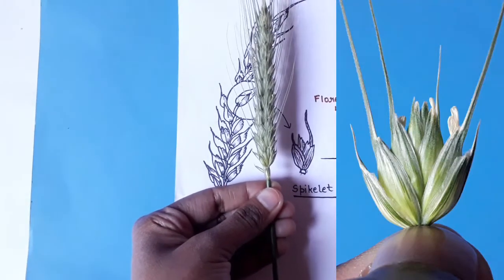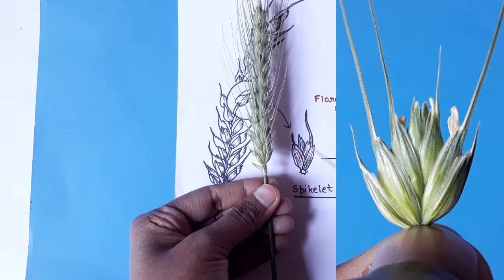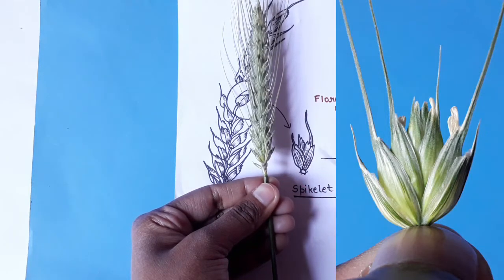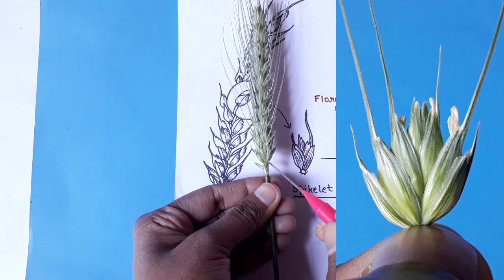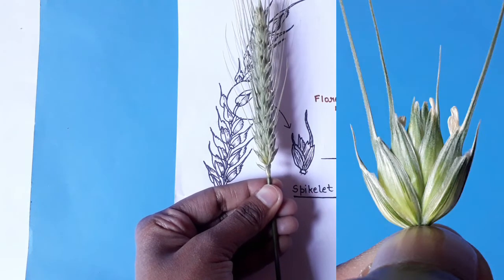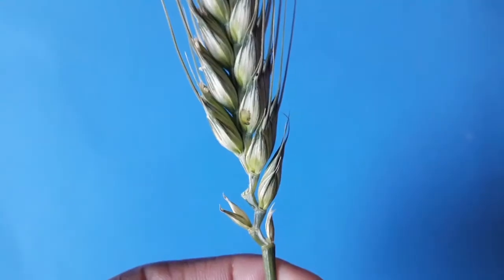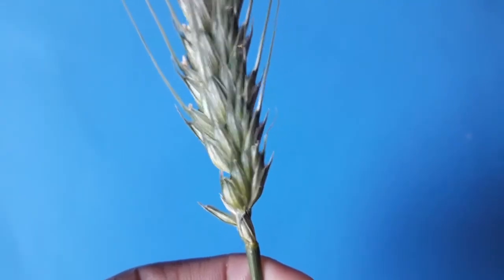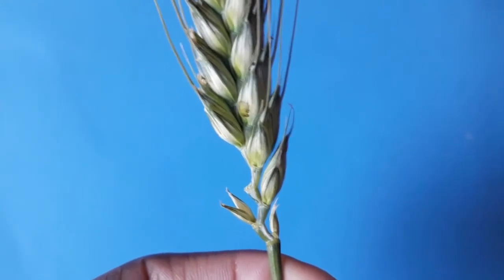Let me zoom in so you can see the spikelet clearly. This single structure here is the spikelet. Once you open this spikelet you will be able to see certain internal structures. We are now going to remove a single spikelet from this spike and study its structure.